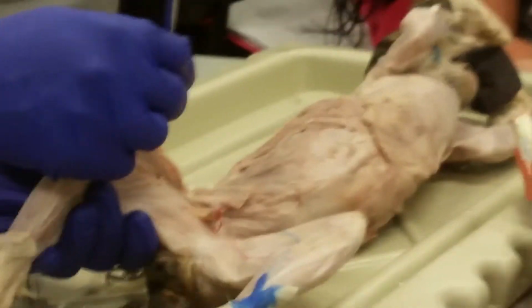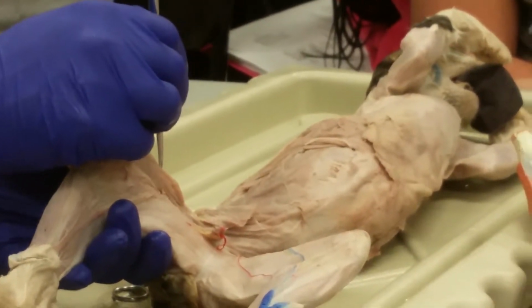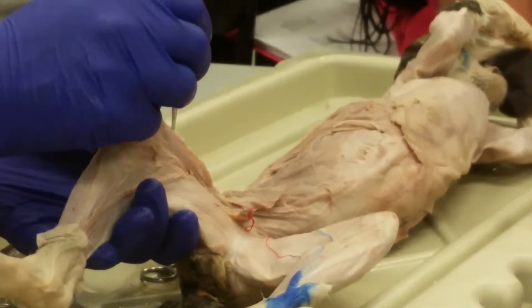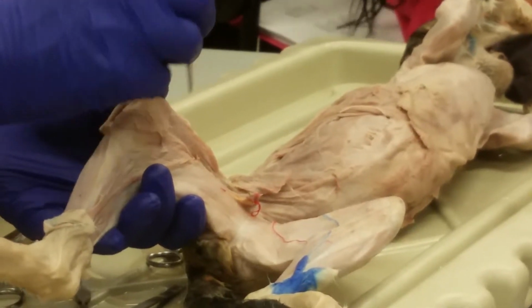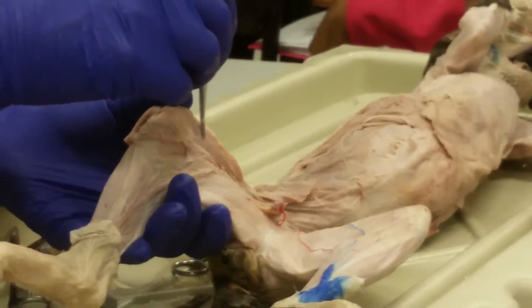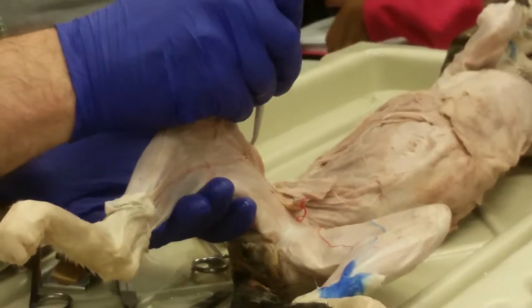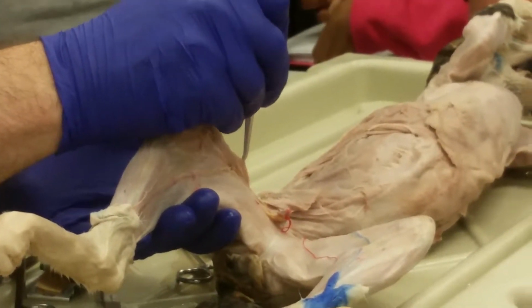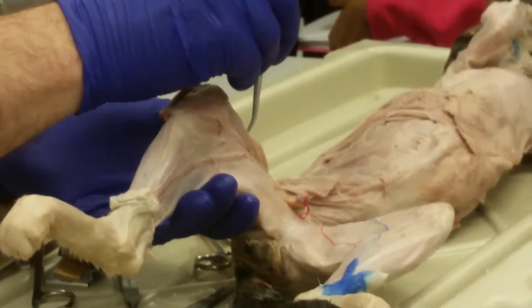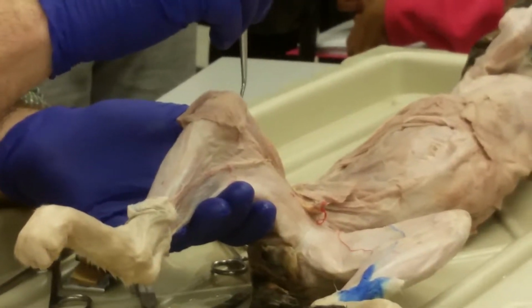Okay, so there's vastus lateralis, vastus medialis, rectus femoris. Now the vastus muscles, they originate in the femur and insert into that patellar tendon. So they're only going to cross the knee. The rectus femoris originates in the pelvis, so it'll cross the hip and the knee. Now there's one more called the vastus intermedius. It's underneath the rectus femoris. It also originates in the femur. We're not going to look for that. So the three vastus muscles originate in the femur and insert into the patellar tendon.